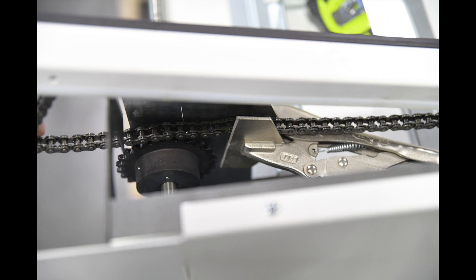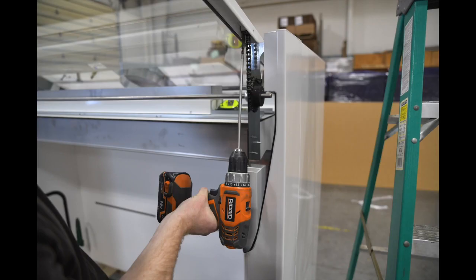but you do need to crimp it down with an approved device to hold it in place. Next you're going to take the screws out of the sash that the chain are held in by. After that, you're going to put the new sash in place and screw the screws back in, keeping this crimped the entire time.